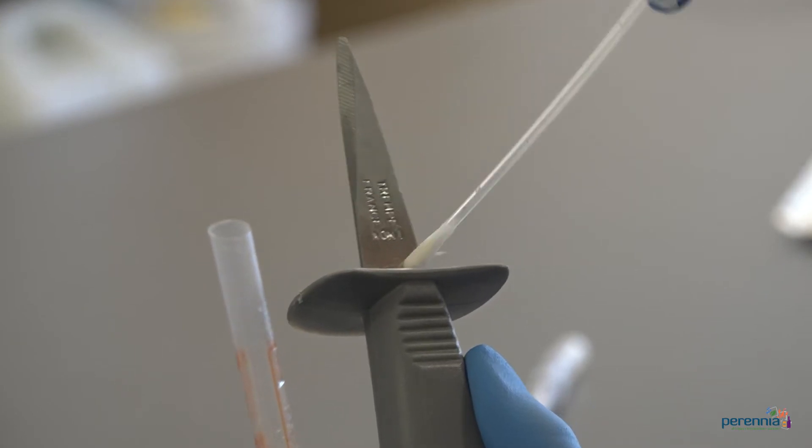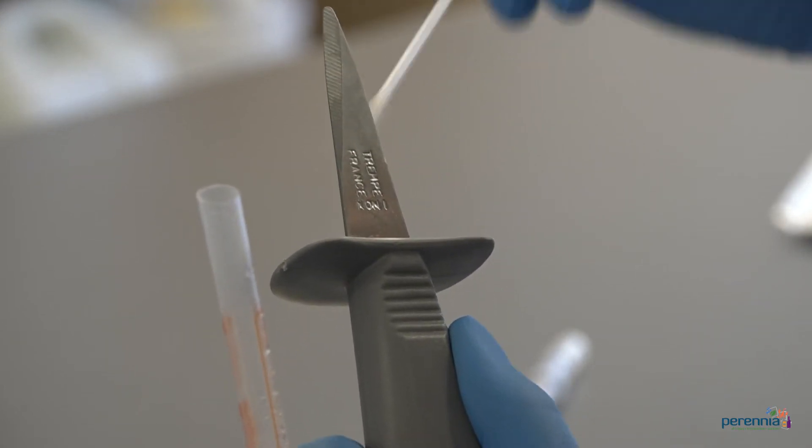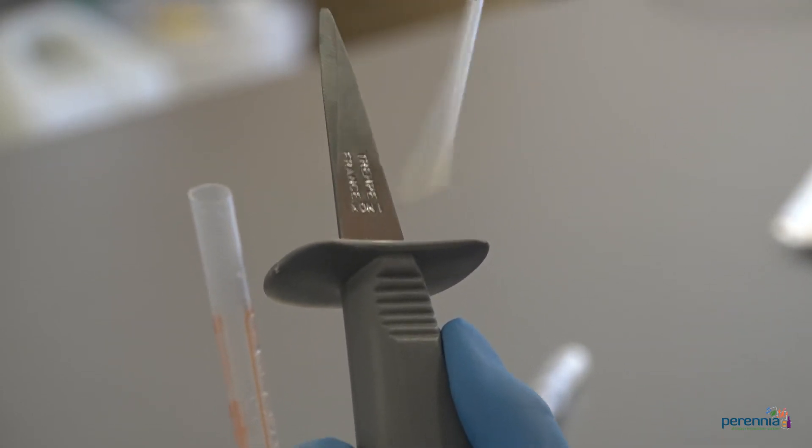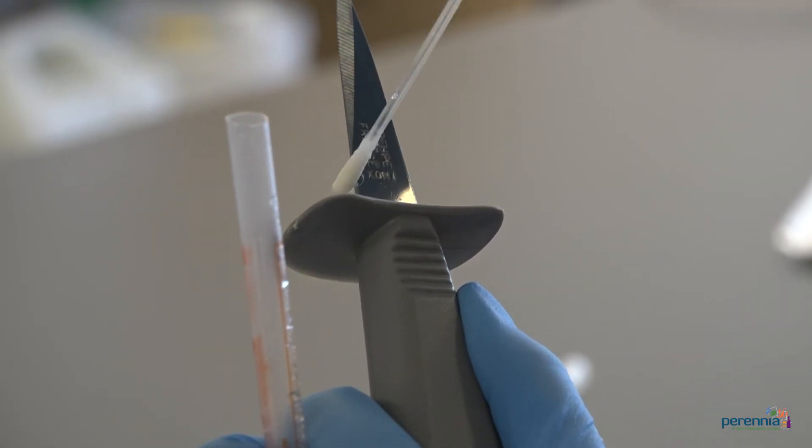When swabbing a smaller item, swab as much of the area using a crisscross pattern ensuring even coverage.